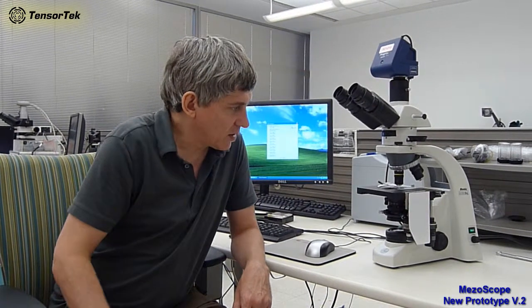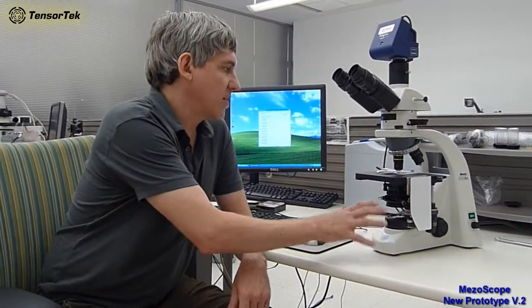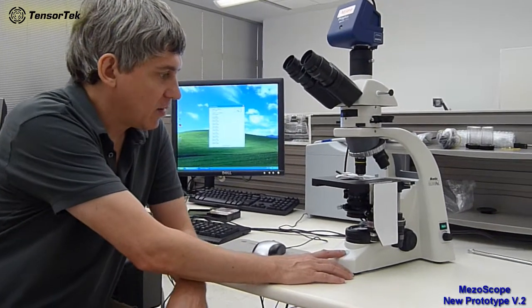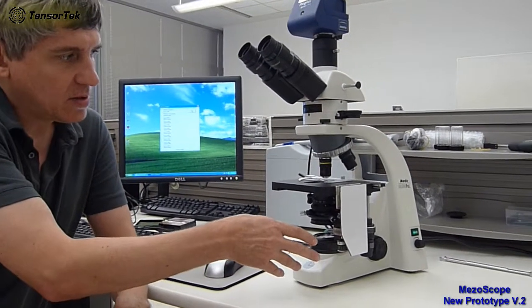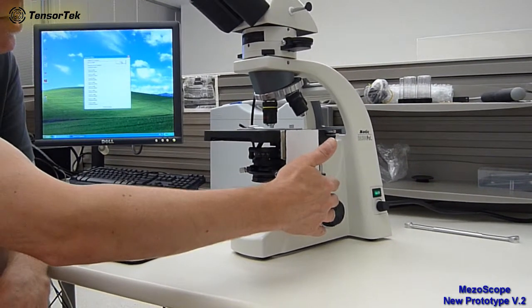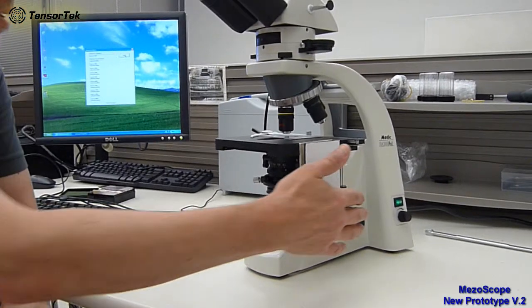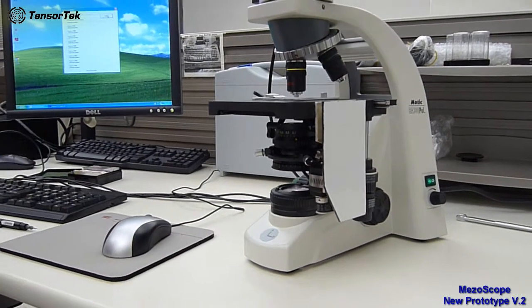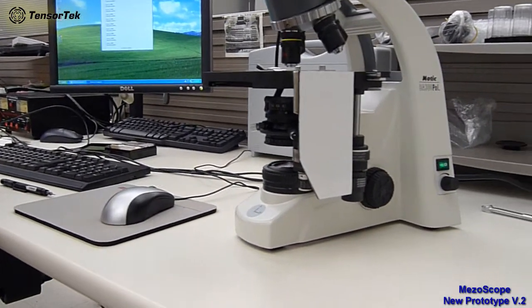And when we talk about low cost, we're talking about approximately 1/10 the cost of the equivalent Leica or Olympus microscope. And just to demonstrate very quickly, we have the basic microscope system. This is a polarizing microscope in this version, and we have motors that are connected to each of the manual slide positioning control arms, and also a third motor connected to the Z-axis or the focus mount of the microscope.